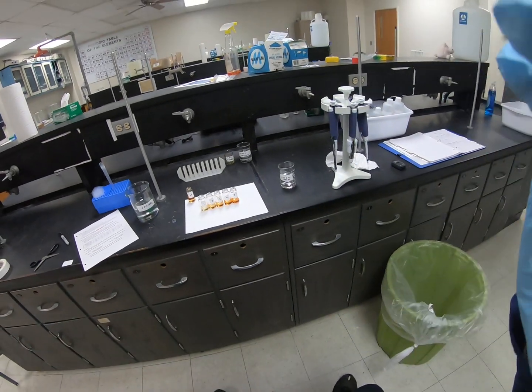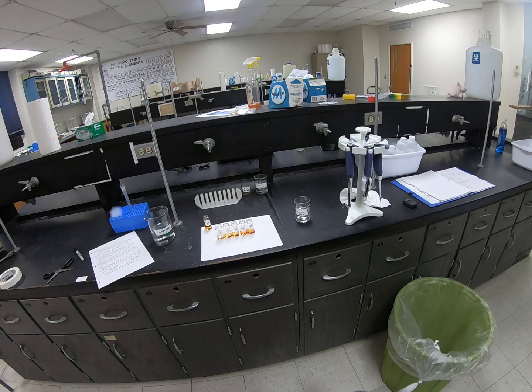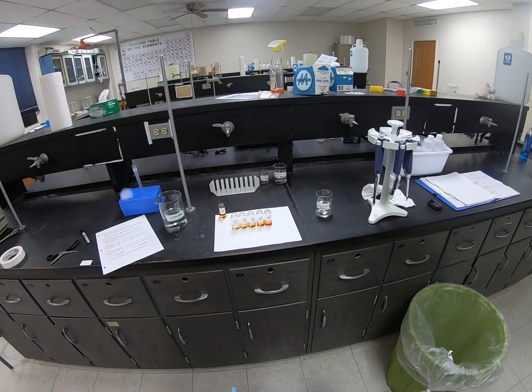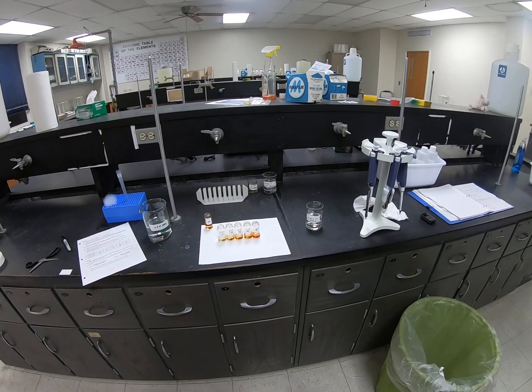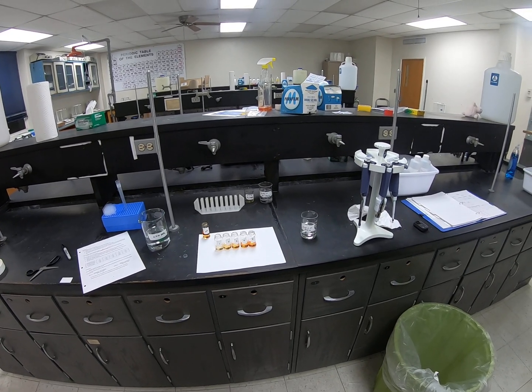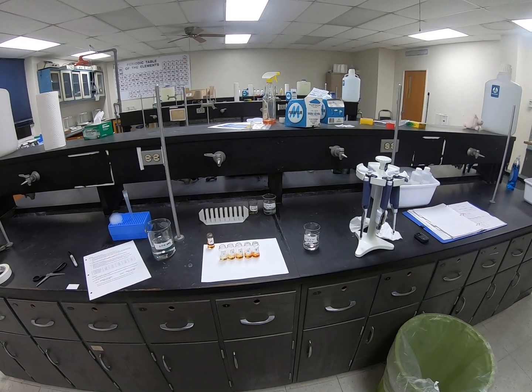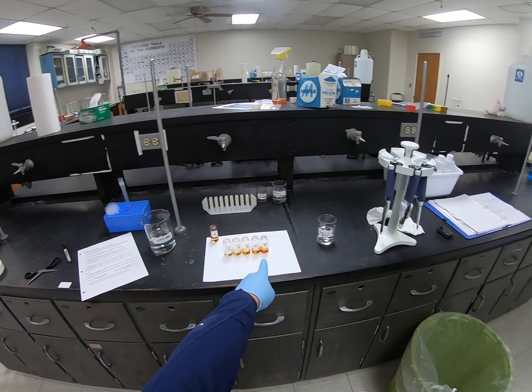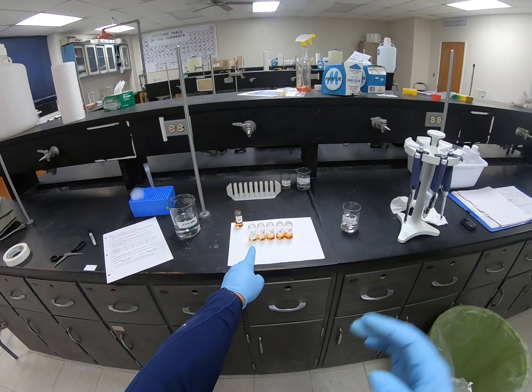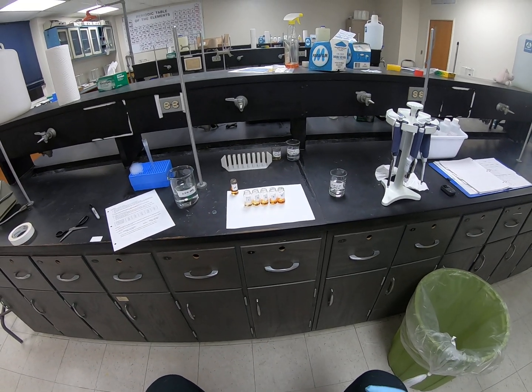So I'm just going to back up and look across the line, and they all look about the same height. Now if you'll look at these and look at the numbers, you'll see that the color intensity changes on these. The one that's the darkest color has produced more of the iron complex. So there's more of the product made in number 5 than there is in number 1. Okay, so that kind of gives me an idea that the system's working like it should.